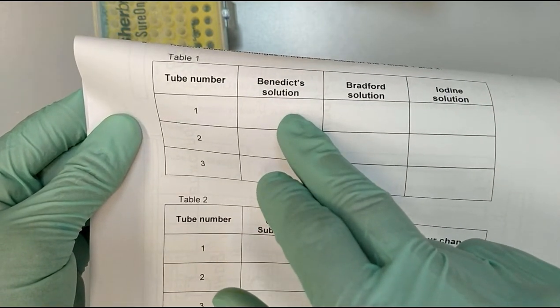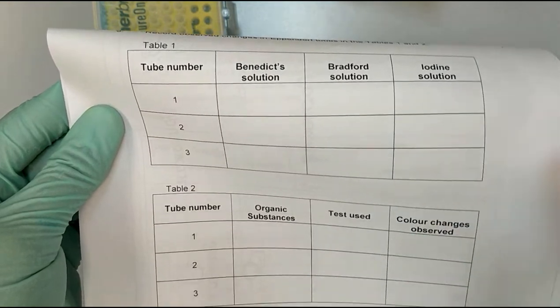And then what happened after the addition of Benedict's solution, Bradford's solution, and iodine.